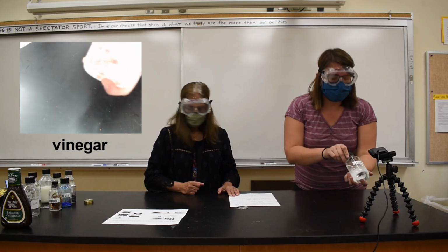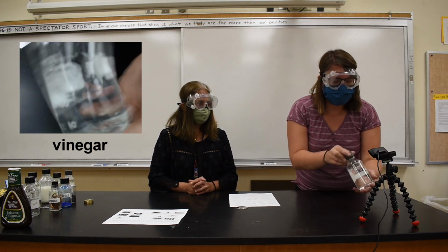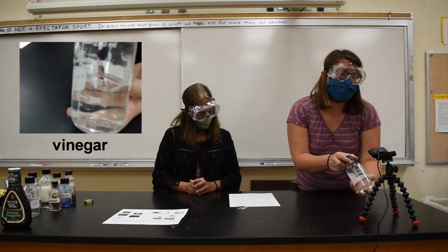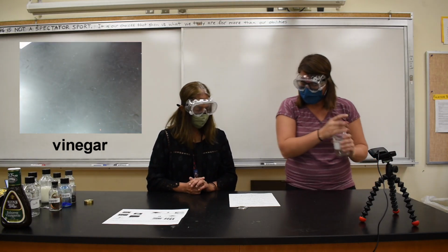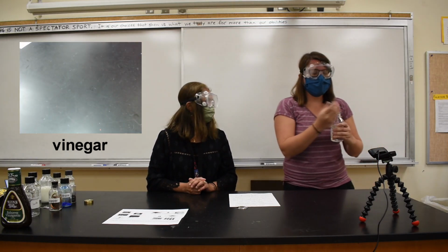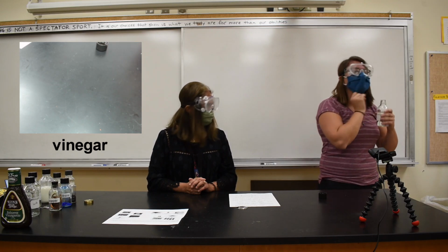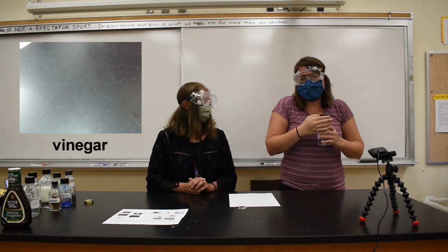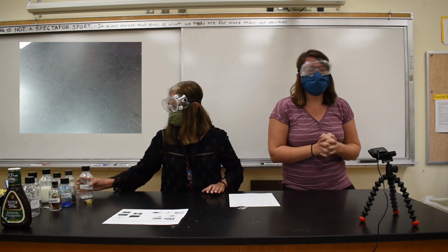Next is vinegar. This one looks similar to isopropanol maybe. Maybe similar to water. Looks a lot like water actually. It's clear. Then we're going to do the smell test. Maybe it smells a little bit like pickles.